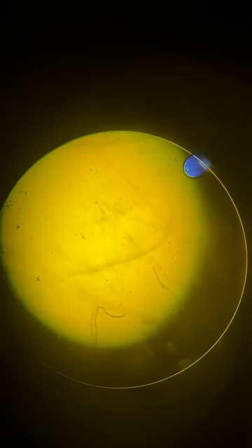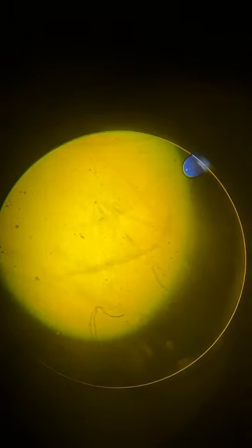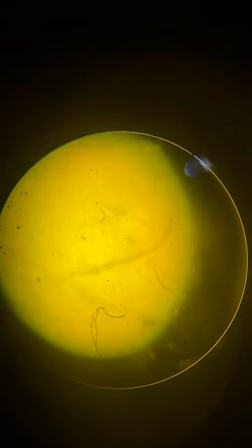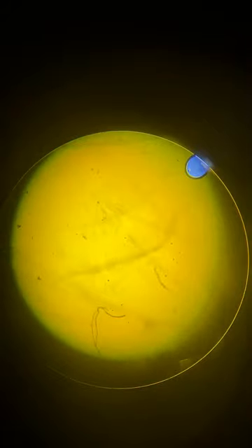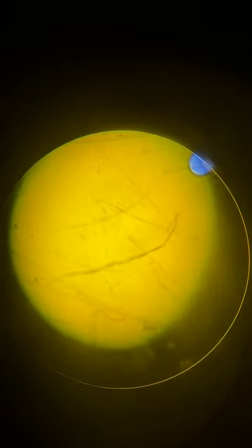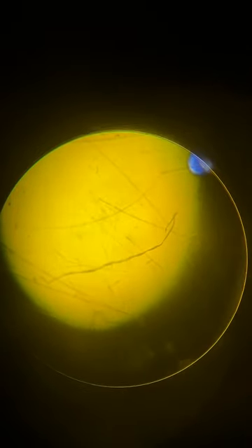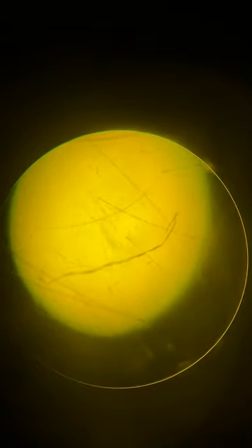When you have completed your mount of your epidermal cells of your onion skin, you want to go ahead and put it on the microscope, objective red, and start to focus it. Use your finger to move it around to try to just scan the slide.